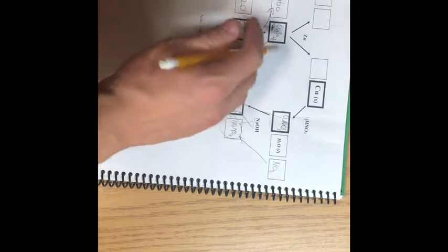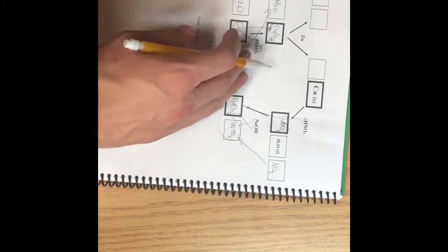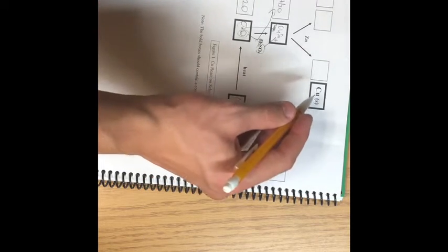The zinc turned into black chunks, and then later on to a red color. This was copper, as the solution went from clear blue to completely transparent. So this is the copper that it turned into. Right here, it's in the beginning of the cycle.